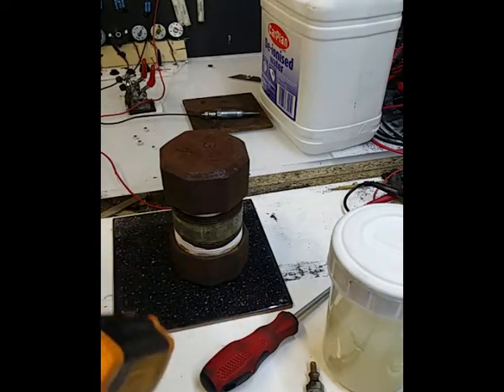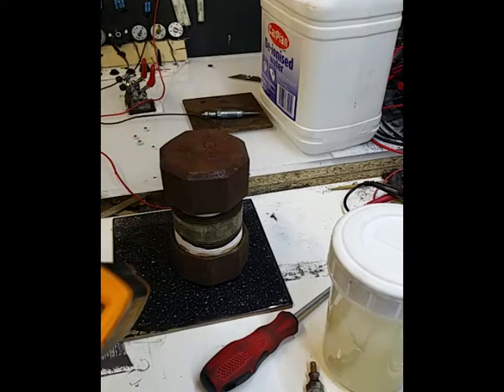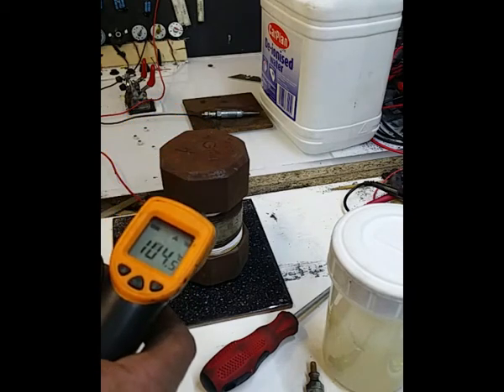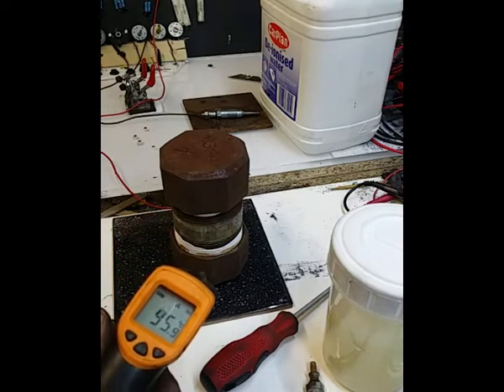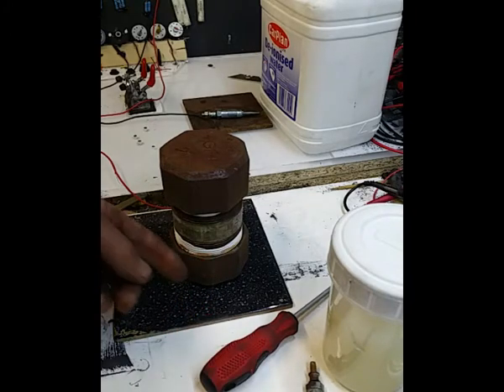Okay, so just a quick update. It's probably been 40 minutes now. I've turned the voltage up obviously to 9 volts. We've got 7.5 amps. Now the top is at 104 degrees. The middle is at 97 degrees. Now I'm guessing that if I try the base, it's going to be cooler. 78 degrees. So the obvious thing is happening now.